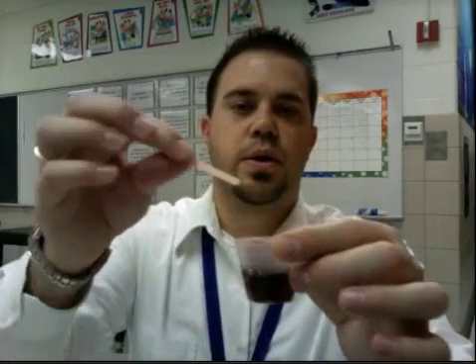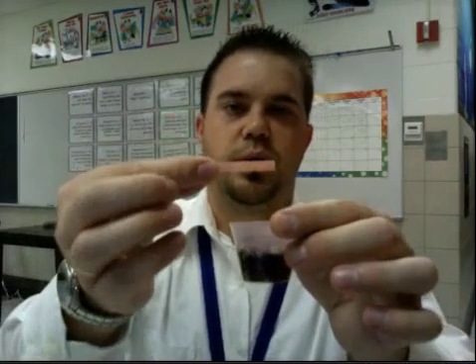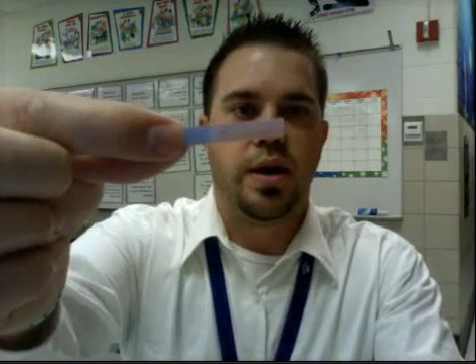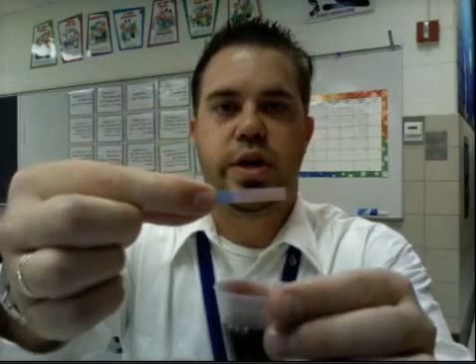Okay, moving on to, here's Coke, or Coca-Cola. Red litmus paper, stayed red. Remember, if I'm going too fast for you, just pause the video and fill in your data table as you go, and start it back up when you are ready. Blue litmus paper. It's a pretty subtle change, but it is turning red. So there's a slight change here with the Coke. The blue litmus paper is turning red.